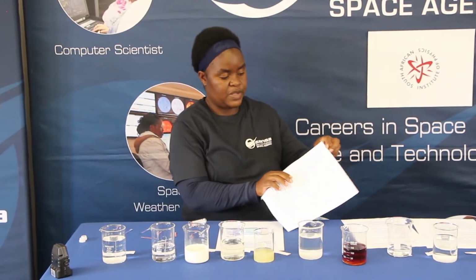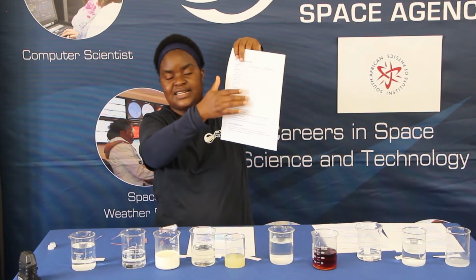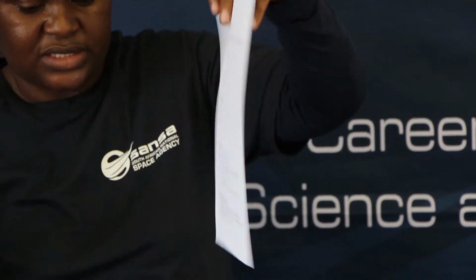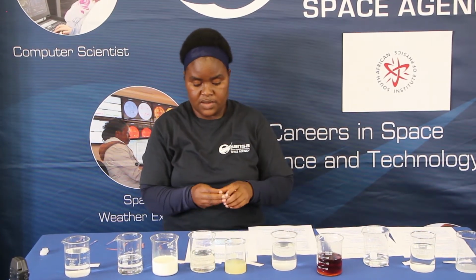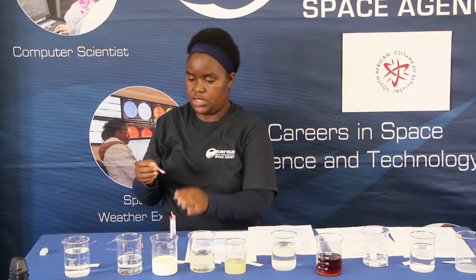So that was it with our blue litmus paper. So my assistant by now has filled the different colors in the table for the blue litmus paper for our different solutions. After that we're going to make the conclusion, decide which ones are acid, which ones are base, and which ones are neutral. So now we're going to repeat the same exercise, but now we're going to use the red litmus papers. So we're going to start with the first one, our water solution.